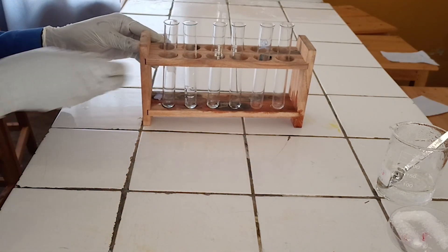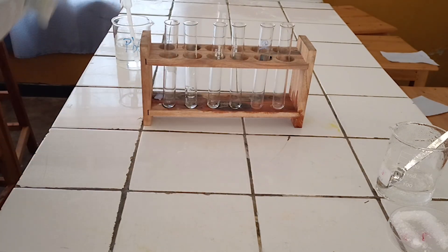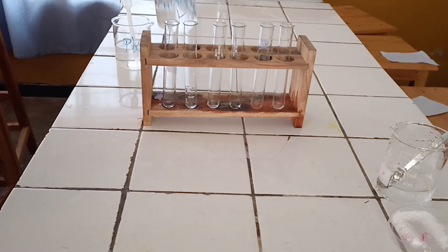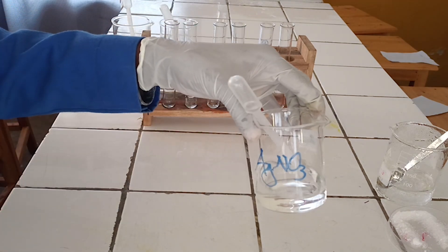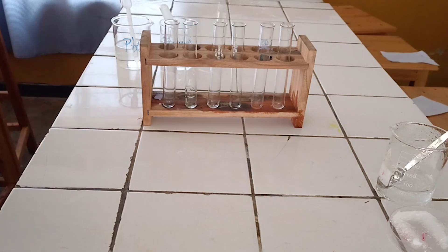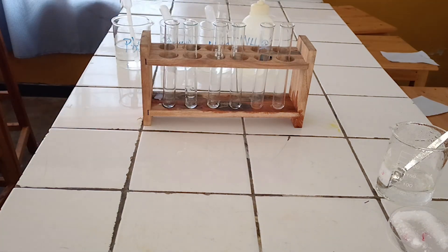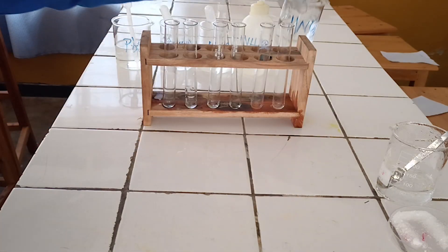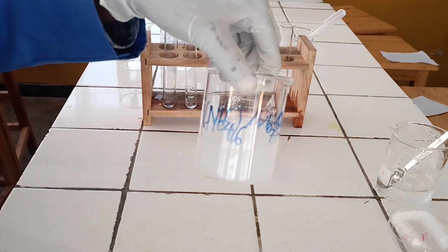Chemicals required: 1. Lead nitrate solution. 2. Barium nitrate solution. 3. Silver nitrate solution. 4. Diluted ammonia solution. 5. Diluted nitric acid. 6. Ammonium molybdate solution.